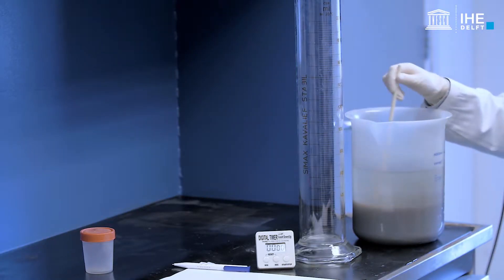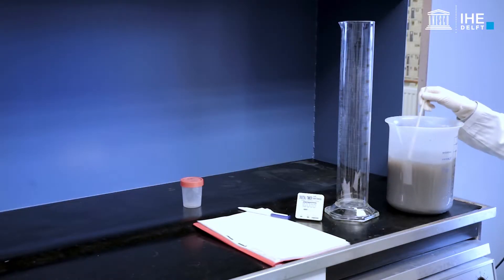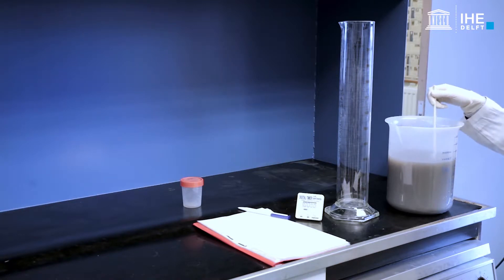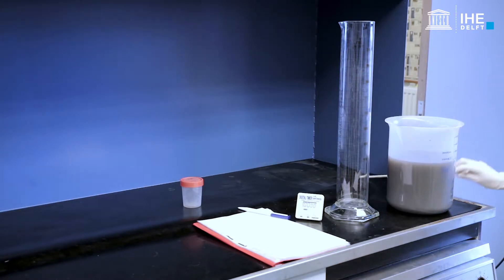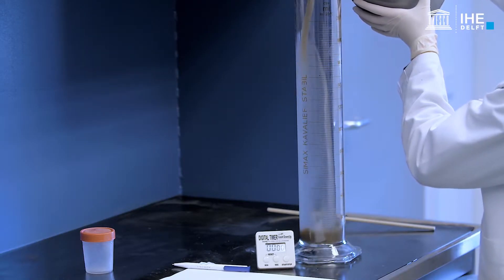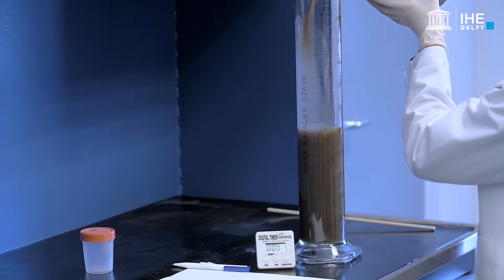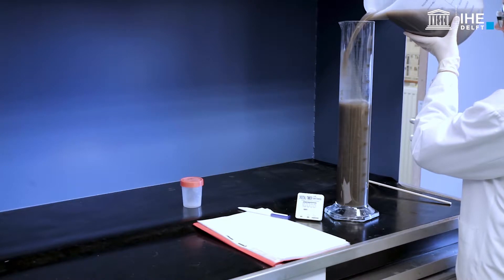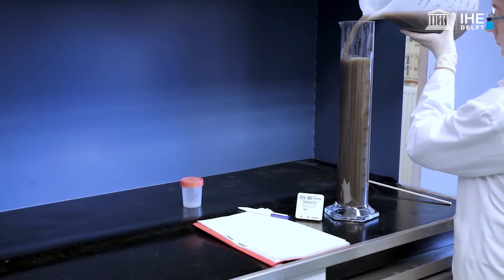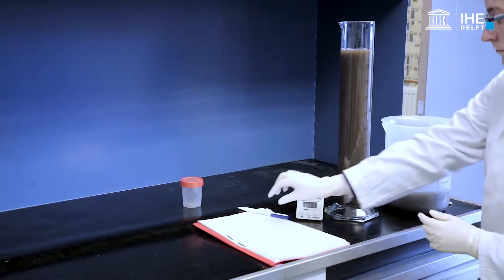Gently homogenise the sample — avoid disturbance of the sludge as much as possible. Fill the cylindrical reservoir with the sample, pouring gently in a steady flow.